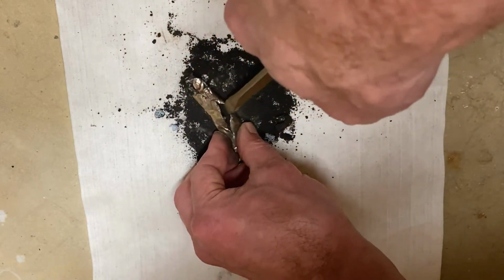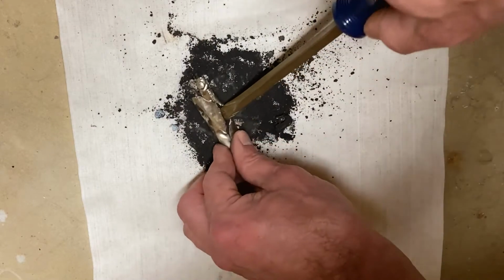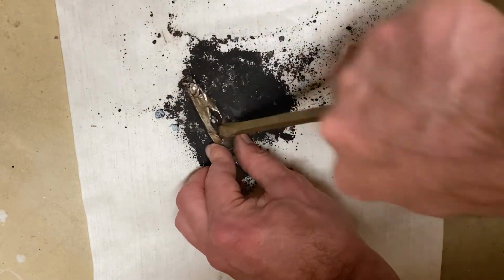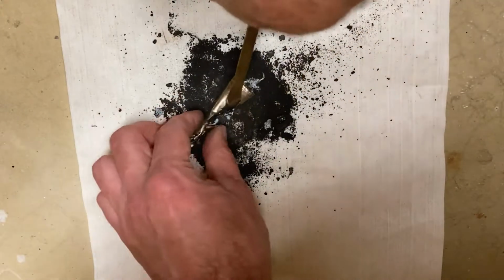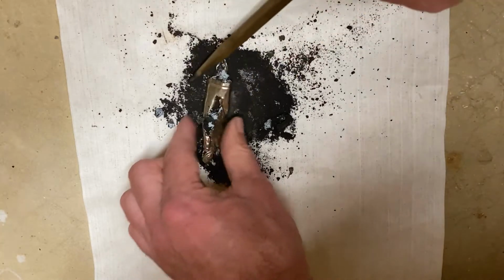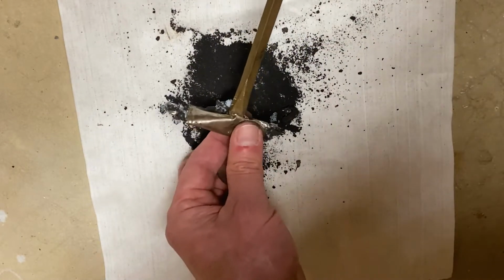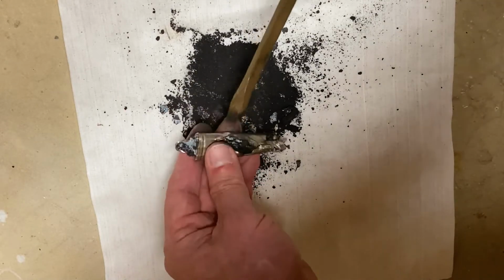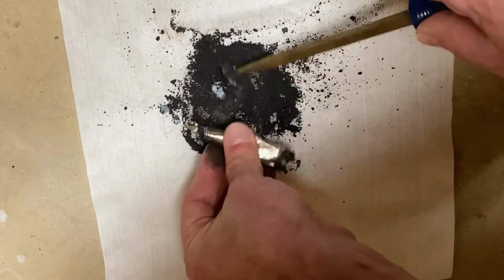maybe, but I'm going to wash my hands after I'm done with this, because I don't really want to get chemical burns on myself. The zinc oxide and the manganese oxide should be fine, but the potassium hydroxide's not necessarily going to be that nice to you. Boy, it's kind of warm, but I think that's more because of the pounding on it with a hammer than anything else.